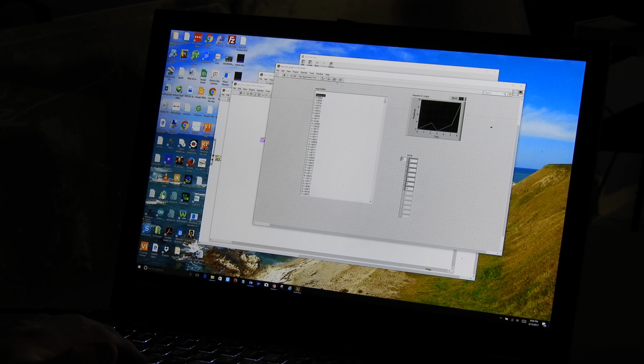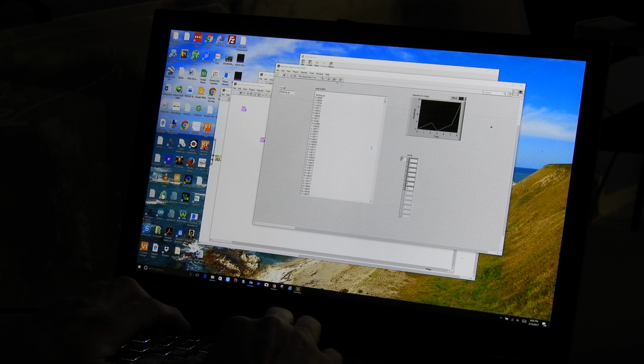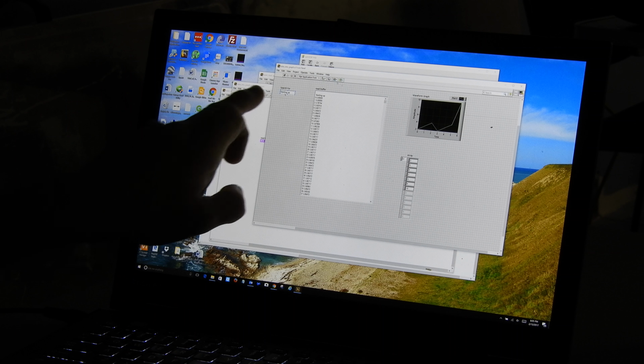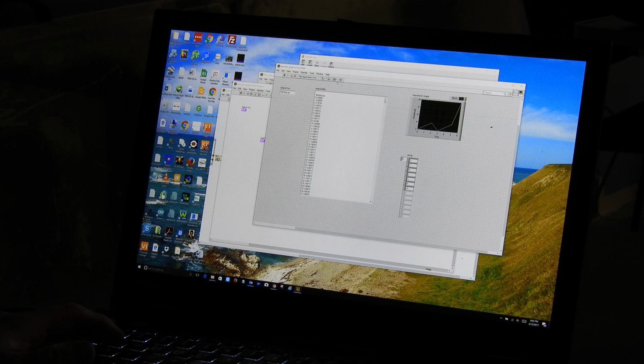I'm going to have it search for that text right there. Okay? So let me just real quickly put a new string down on the screen here. So let's go to string and path. Here's a string constant. I put a string constant down, and now I put that starting up little string snippet. So I'm going to call this string search for. Okay, so now we have that text, and I'm going to do that trick again where I say data operations, make current value default, and save that as the default value for that string control when I save the VI. So now this is the default value that goes in this string, and in this read buffer string, whatever all that stuff is, the default value saved into that string.